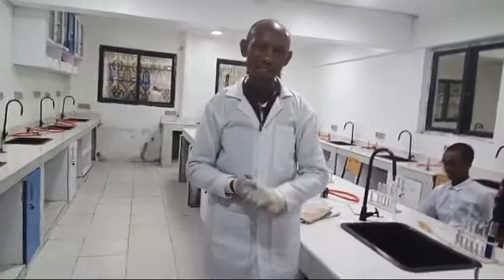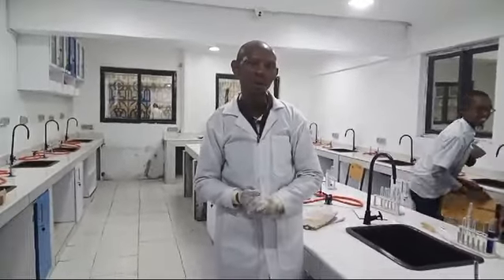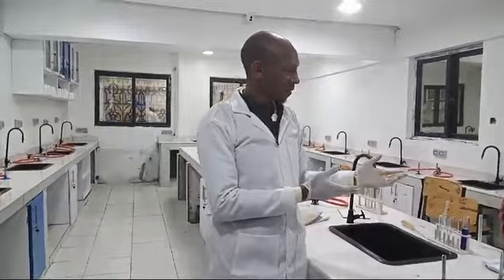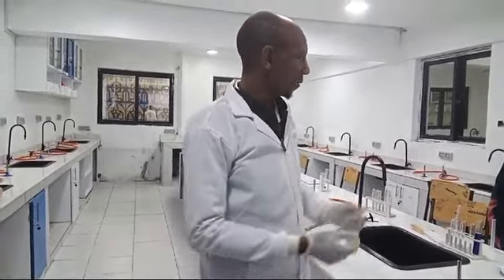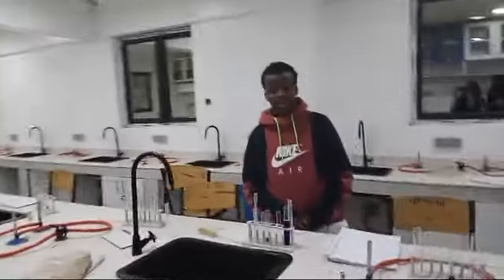Welcome to this class. It's a biology practical lesson. We are going to discuss how to carry out food tests as far as ascorbic acid is concerned. I'm going to give my student here an opportunity to demonstrate how we normally carry out food tests. Welcome, Kamaru. Take us through the procedures and everything.